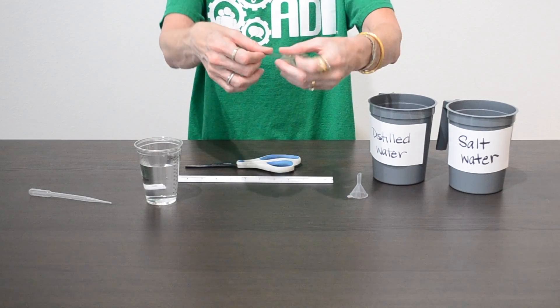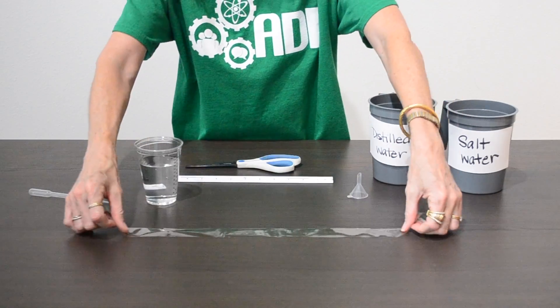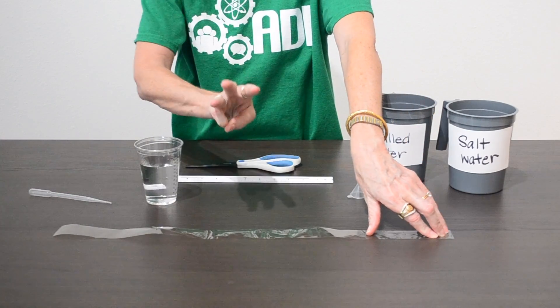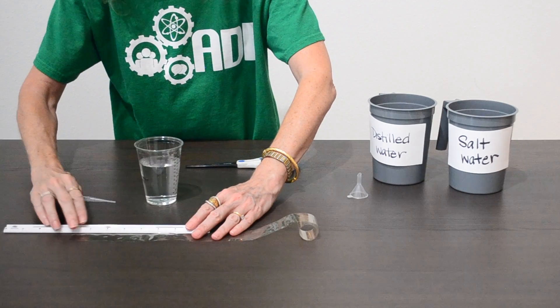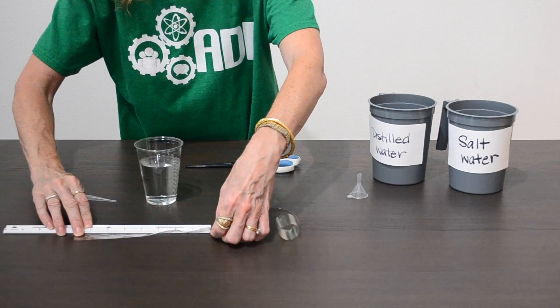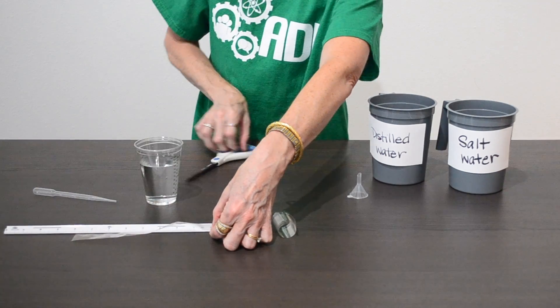Here are some tips for setting up red blood cells in salt water. Each group is going to get a section of dialysis tubing about 24 inches long and will need to cut that into three equal pieces, so about eight inches long.